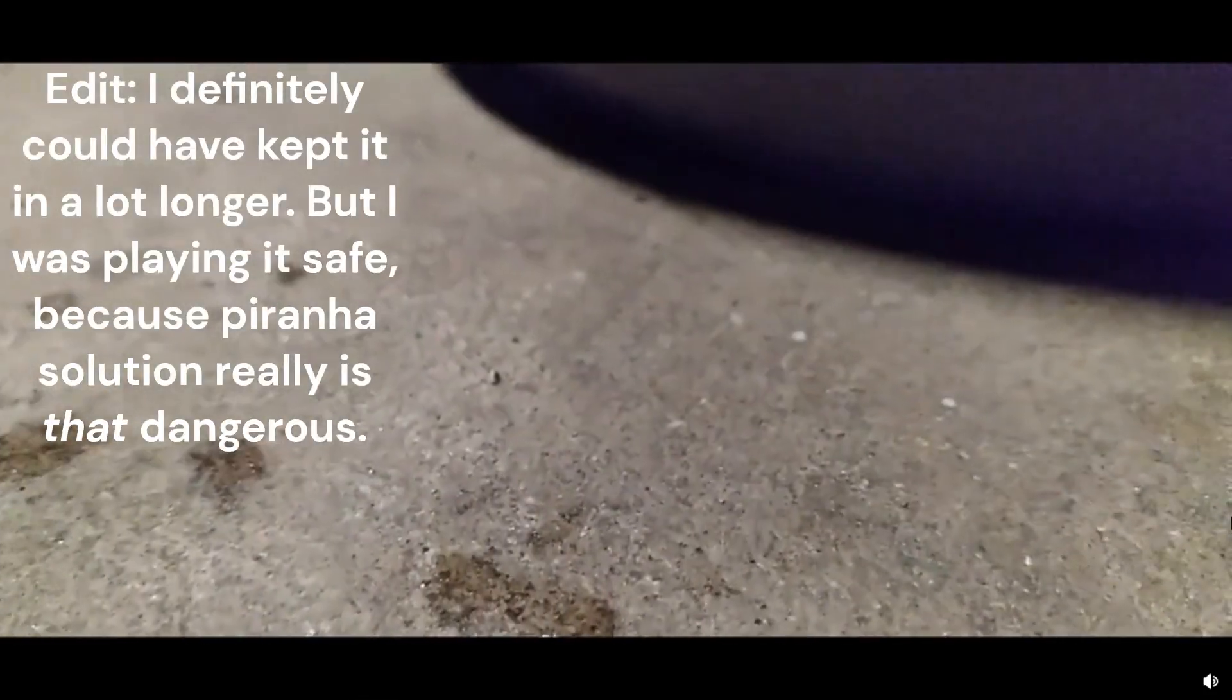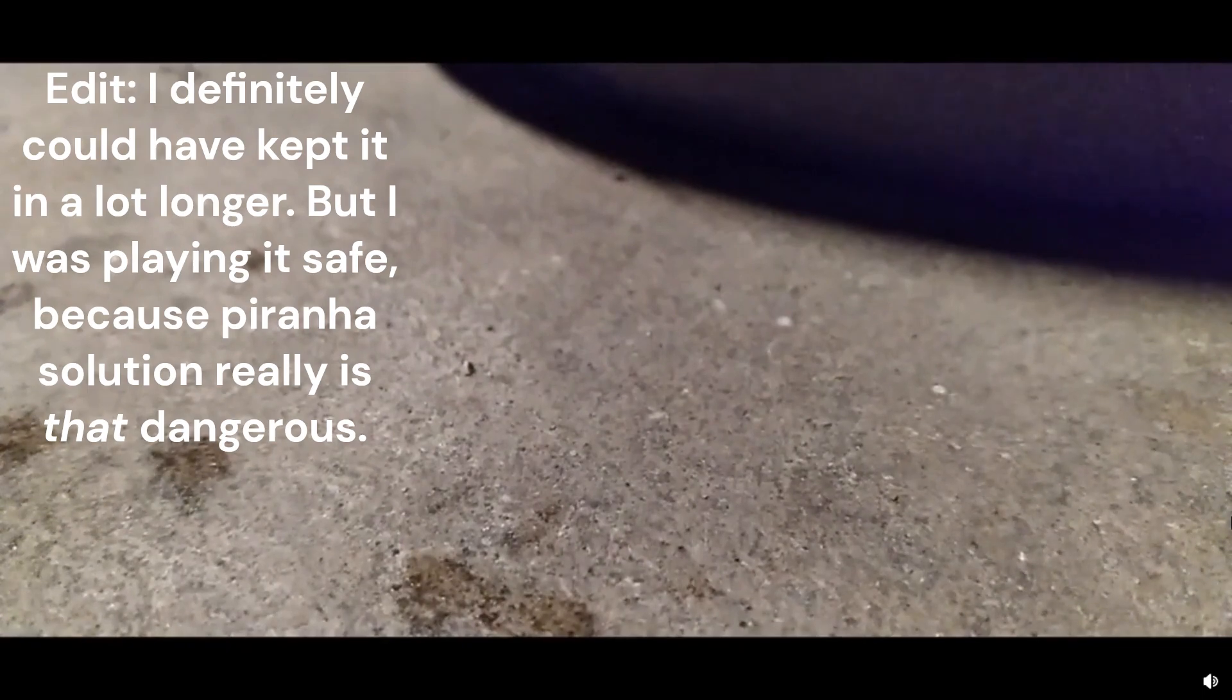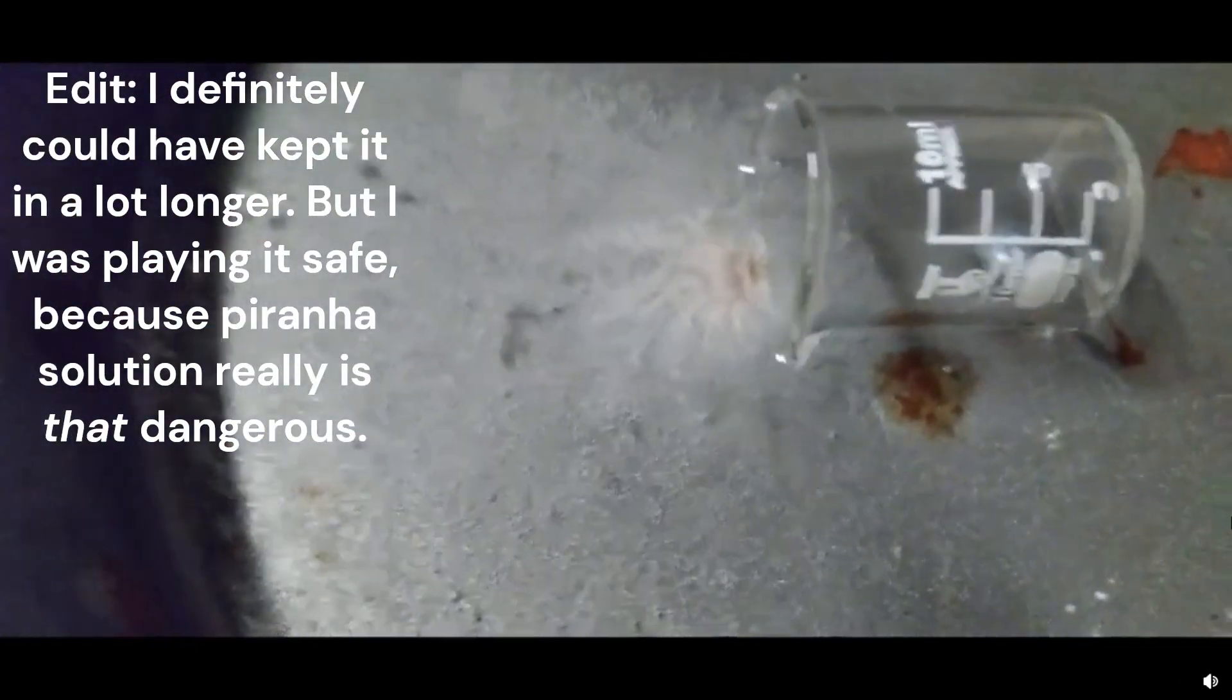All right, it's getting, okay, I'm not comfortable with this anyway. It's getting a little bit excited. Okay, just like that, you disarm it instantly. Right away, just disarm it.